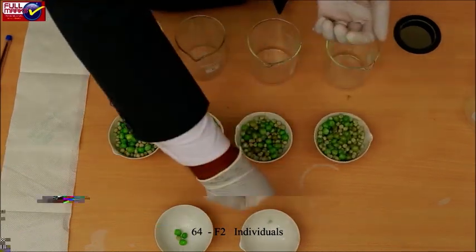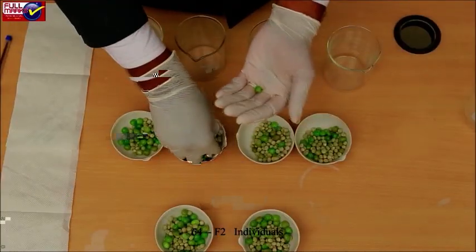Repeat the whole procedure from steps 1 to 9, six times, and tabulate your results.